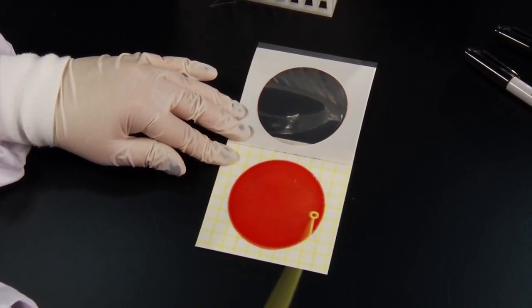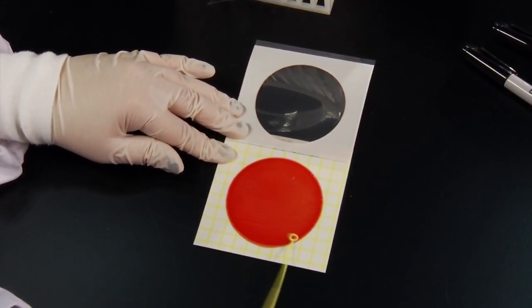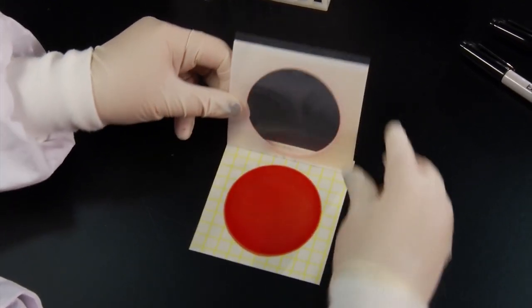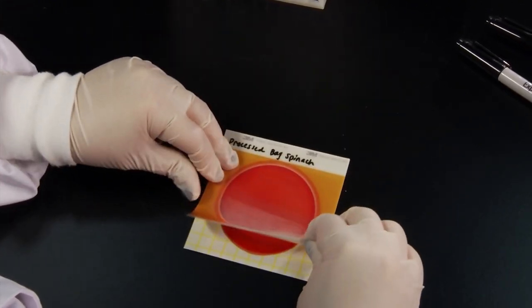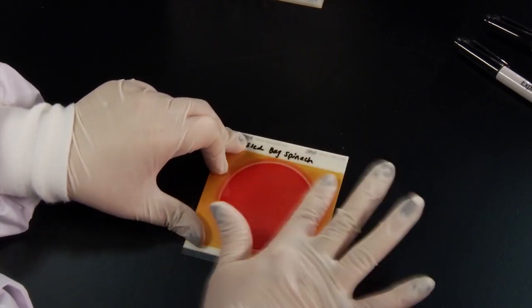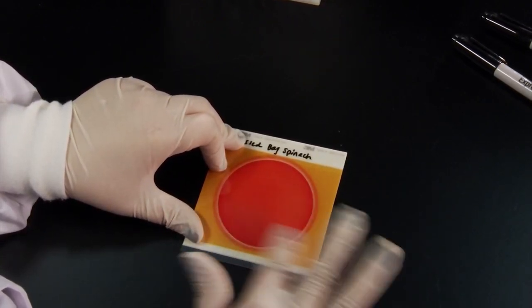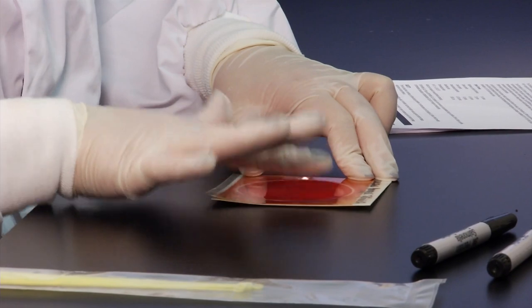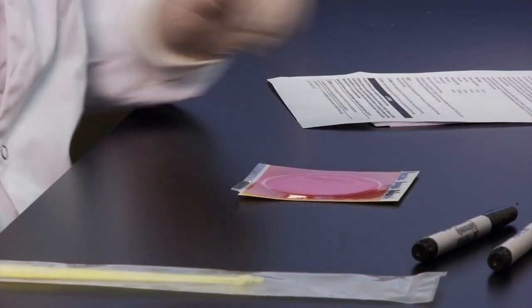Carefully roll down the top film to close the 3M PetriFilm Salmonella Express Plate. Gently apply a sweeping motion with even pressure across the top film to remove any air bubbles in the inoculation area.